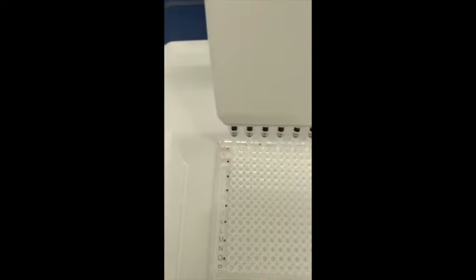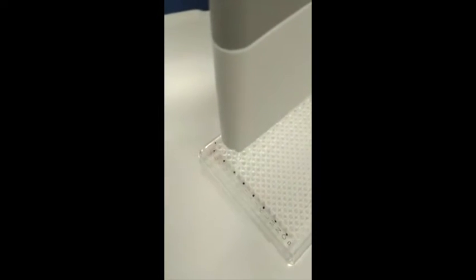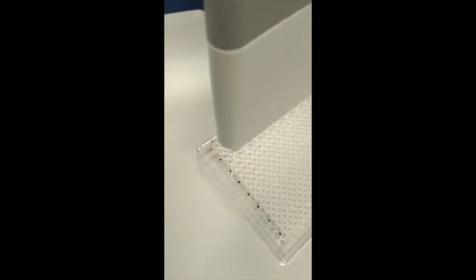Then into row B, take your sample and also jump over the second well and go to the third. As you can see here, I highlighted it with black dots. The same from C from the first plate, then here again one row skipped, and this is done on the second plate. That's how we do it when we do it manually.